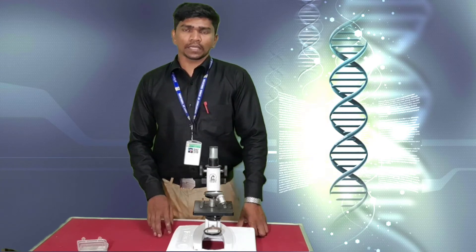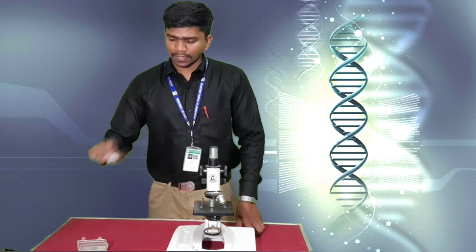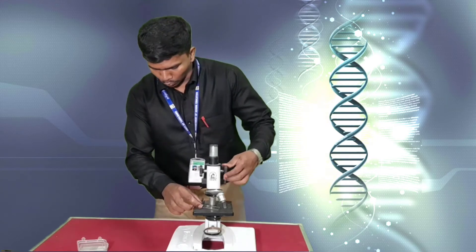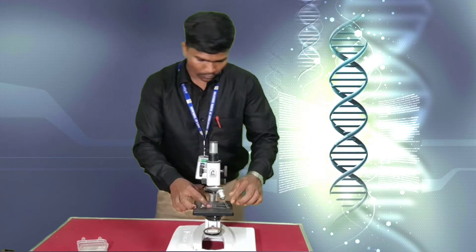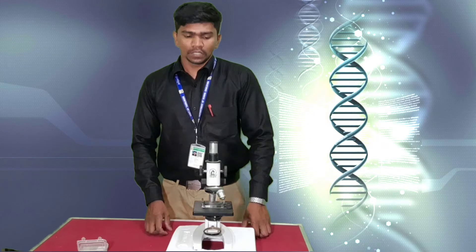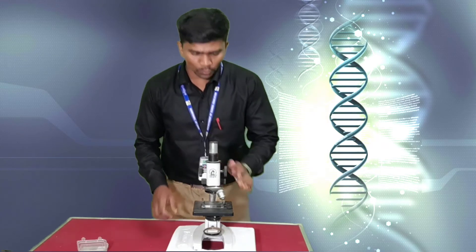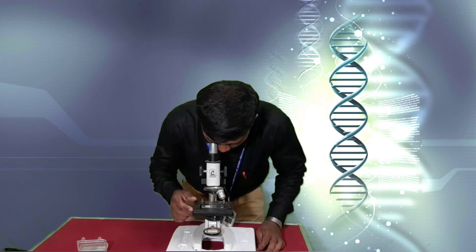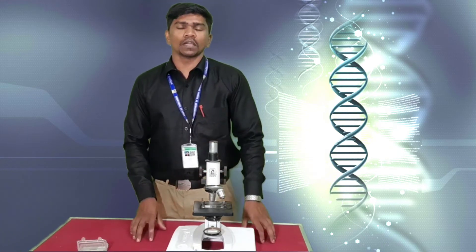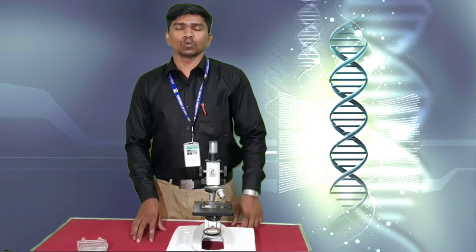In this practical they give a slide like this. This slide should be mounted in the microscope either by yourself or by your science teacher. You can see the specimen through the microscope by adjusting the eyepiece lens. After that you have to identify and write the notes.